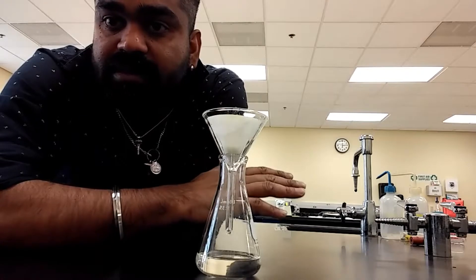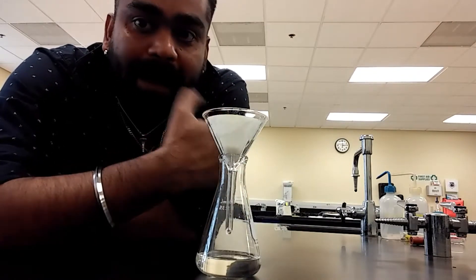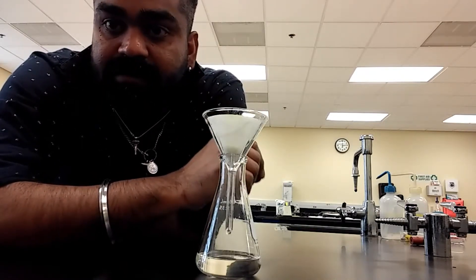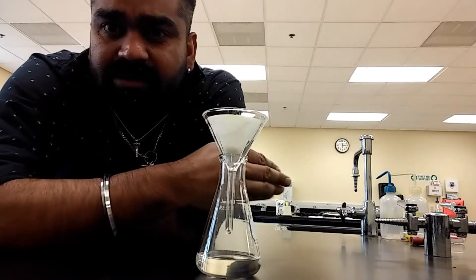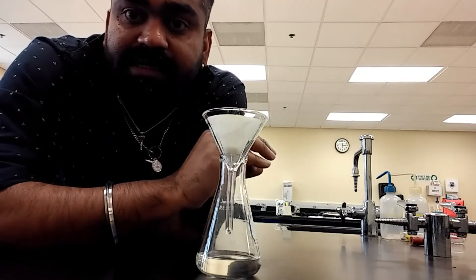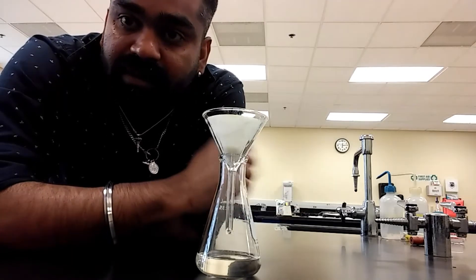Make sure your setup and glassware are clean. Add a boiling chip and make sure you don't go past 25 to 30 on the rheostat. Once reflux starts, that's when you start your timer — not when you turn on the heat for the first time. Once reflux starts, you can cut the heat down to about 25, because you don't want to heat it too fast, then reflux for 30 minutes and turn off the heat. Do not try to disassemble the round-bottom flask from the setup because it's been under pressure — you'll probably end up cracking the glassware, and it's going to cost a lot of money.